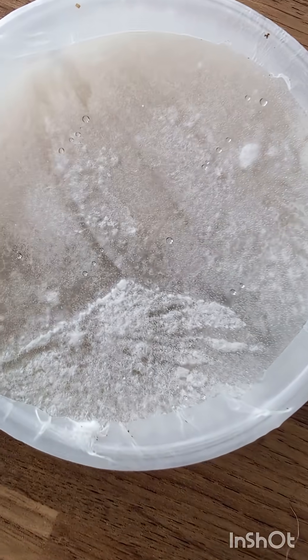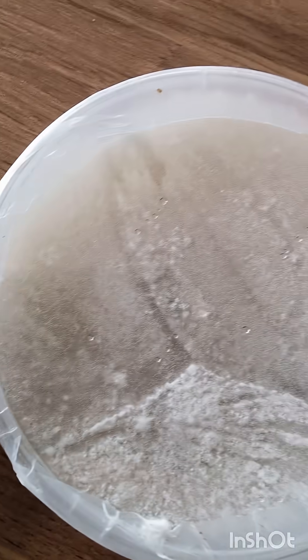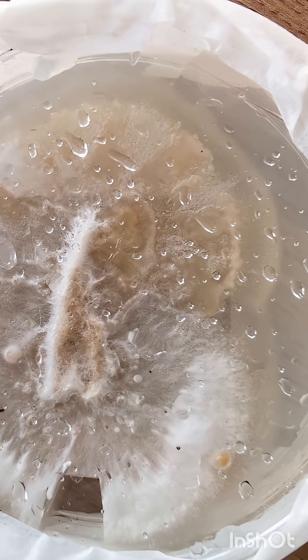After a few days or a couple of weeks, if it's gone well it'll look like this — lovely fluffy, clean mycelium. And if it's gone bad, it will look like this — not so tasty, not so yummy, bad mycelium.